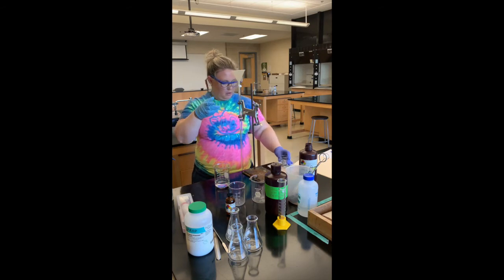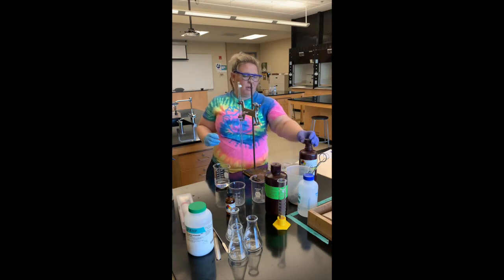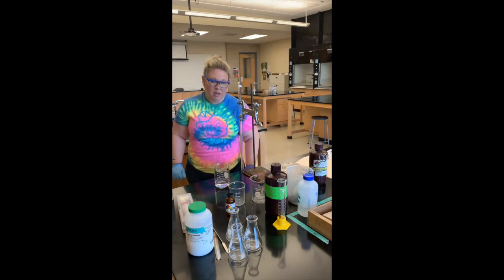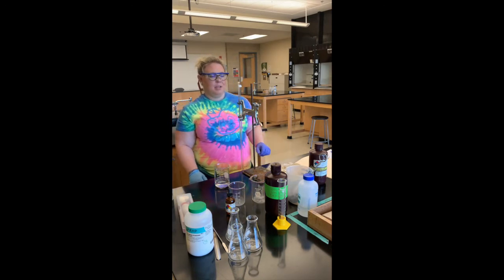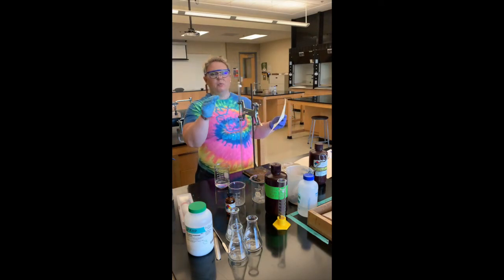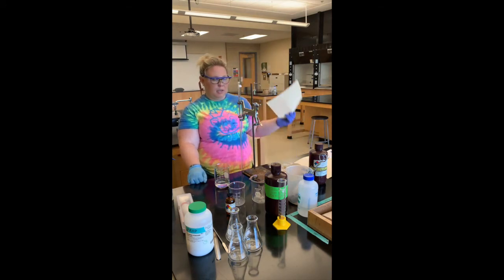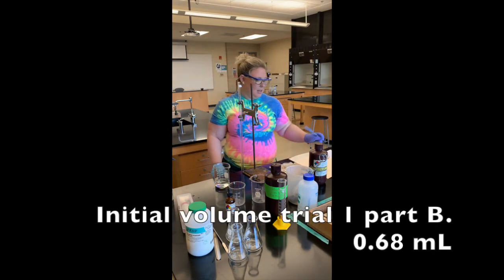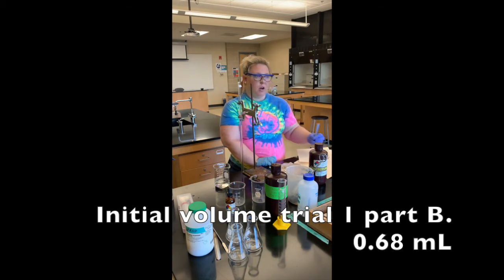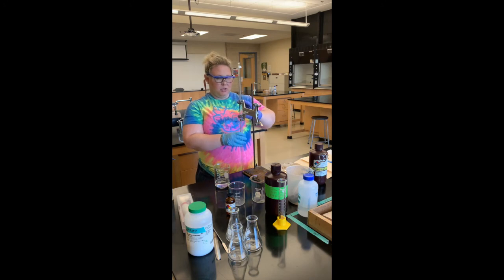I am pretty close to zero here. Before I put it back up on the table, I'm going to use a piece of paper behind the burette to read the meniscus. You always want to put the burette back on the table before you titrate — doing it off the table would end up in a spilled solution or broken glass. I'm going to measure my initial volume for Trial 1 of Part B: 0.68 milliliters is our initial volume for Trial 1 of Part B. Now the burette is ready to titrate.